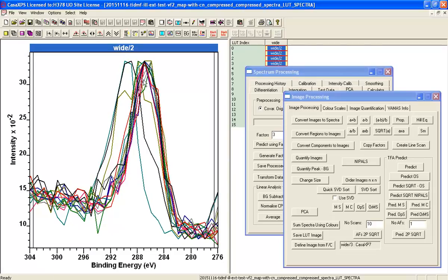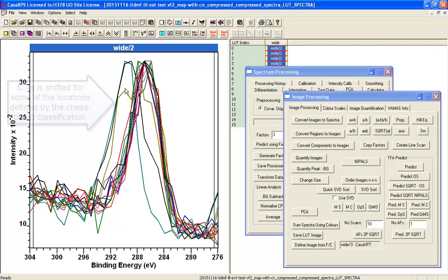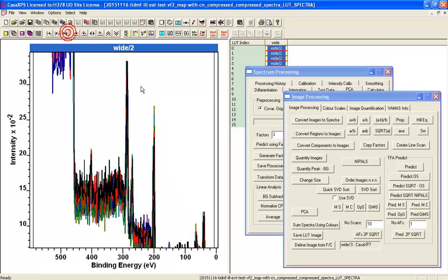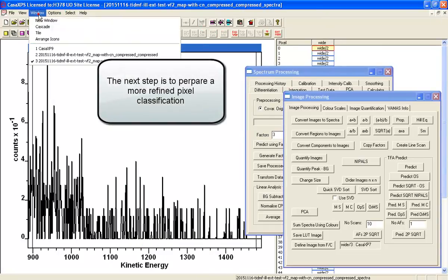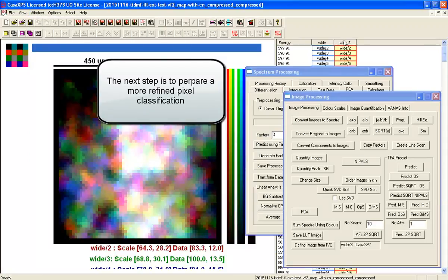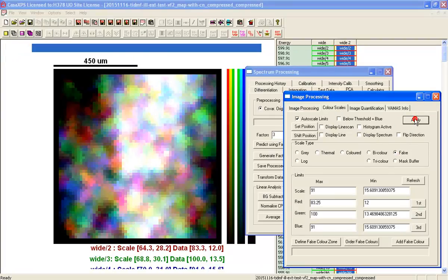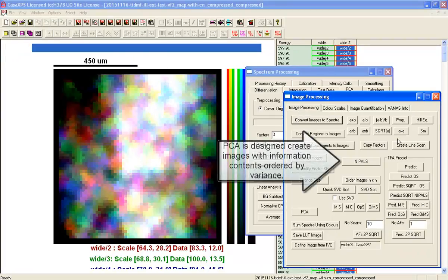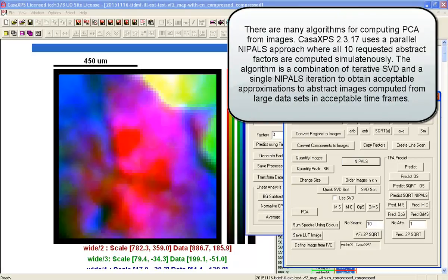So this is the carbon peak, and you can see that while the majority of these spectra all have a similar sort of binding energy associated with the carbon, there are some that are not. And what we need to do is work out what it is that's gone wrong and where in the sample it's gone wrong. So let's go back again, and this time I'm going to set the false color here, and we will do a PCA type calculation on these images, and there are 605 images here, 64 by 64 pixels.